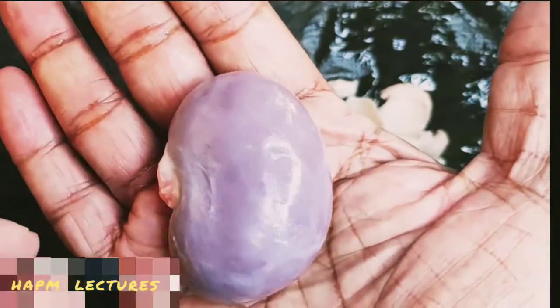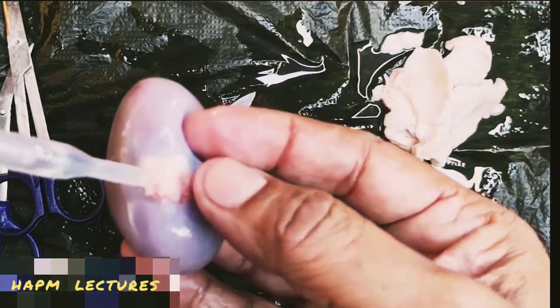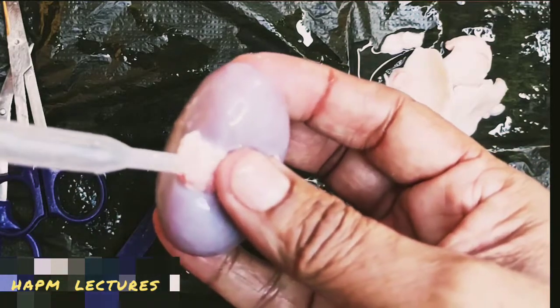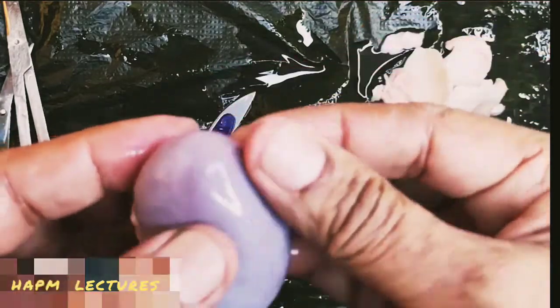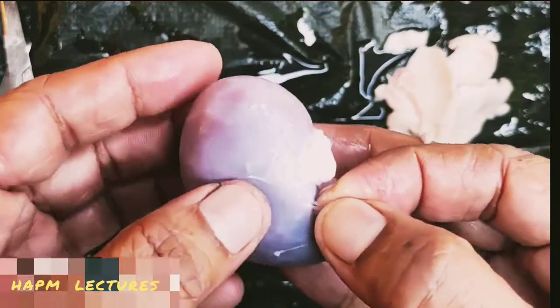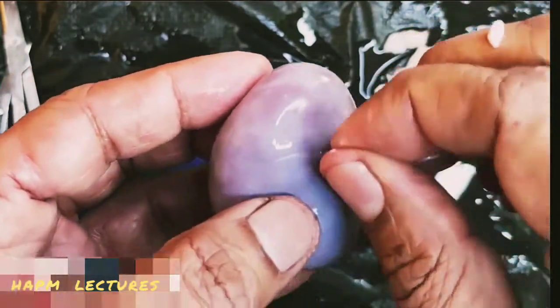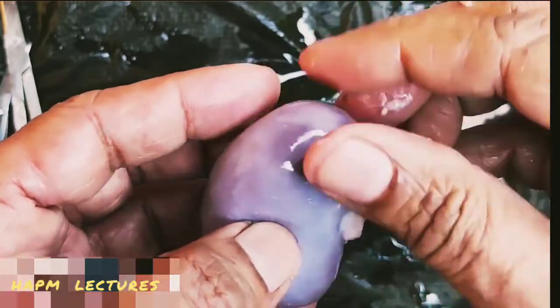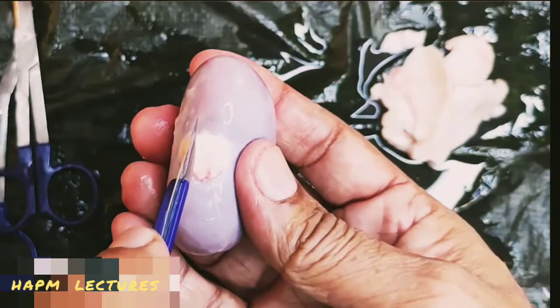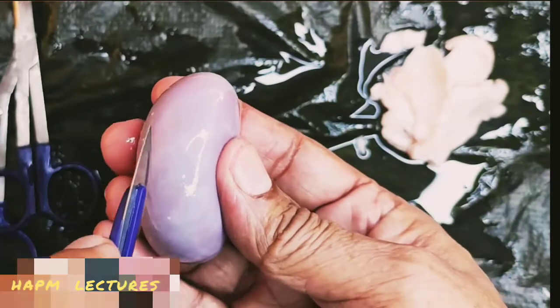The hilum is the place through which the renal artery, the renal vein, as well as the ureter, exit and enter. Now this outer covering is a thin layer. Inner to that we can see the innermost renal capsule, a smooth, transparent, fibrous membrane, continuing to the ureter, which gives a barrier against infection of the kidney.